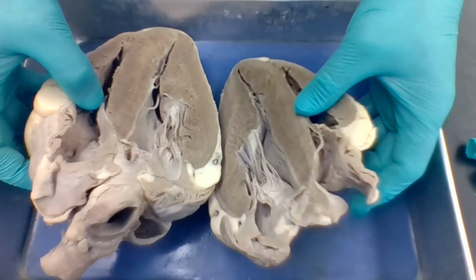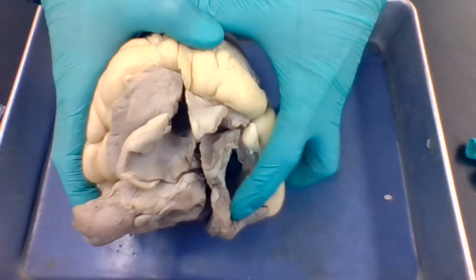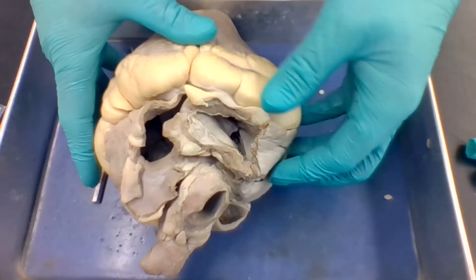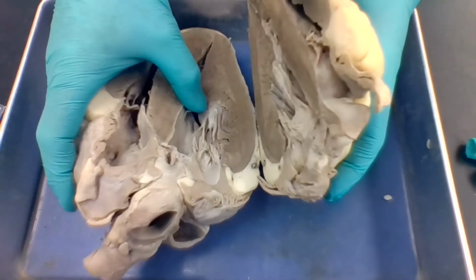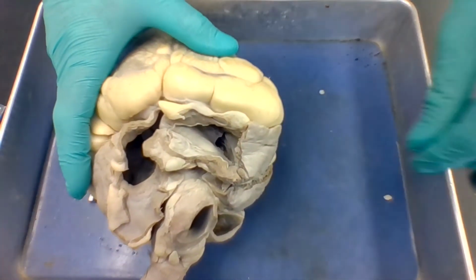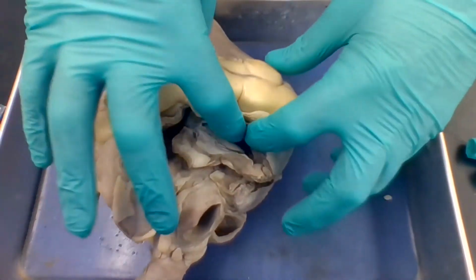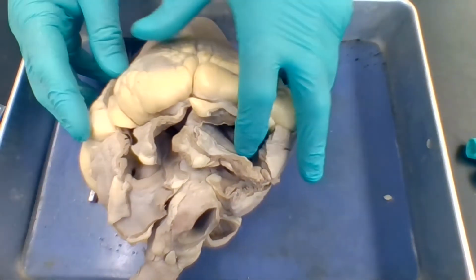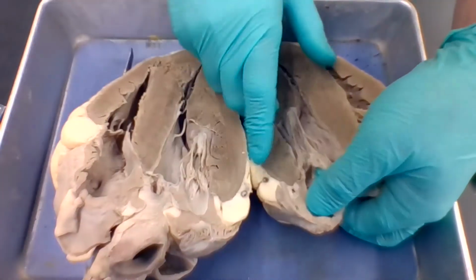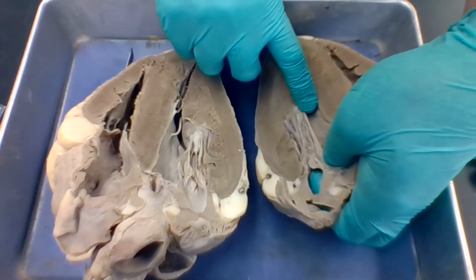Okay, so now we've got nice oxygenated blood, and it's got to come back to the heart now. So the pulmonary circuit has completed its job. Now it's going to come to the systemic circuit. So coming back to the heart, we've got the pulmonary veins. The pulmonary veins, it's cut off here, but the pulmonary veins are going to empty into the left atrium, okay? The left atrium is going to contract. That's going to push open the bicuspid valve, right?